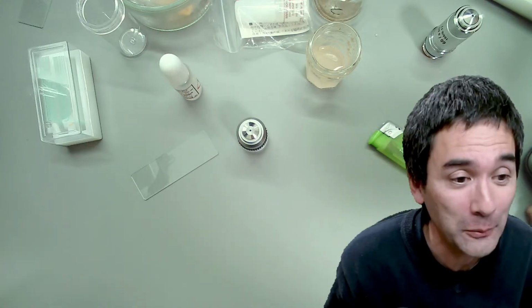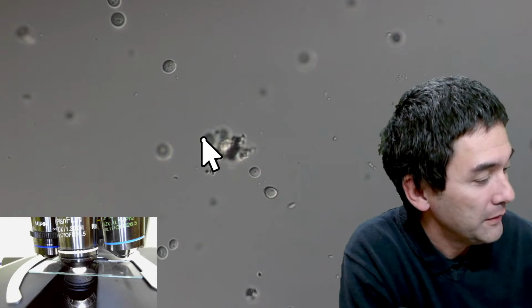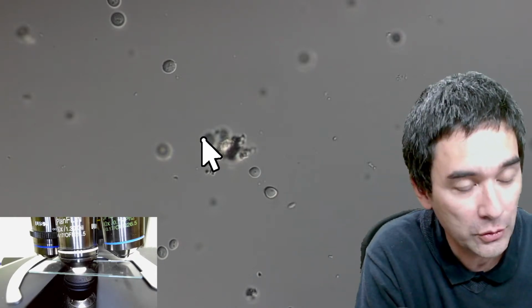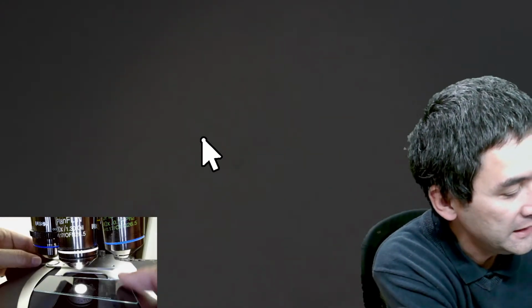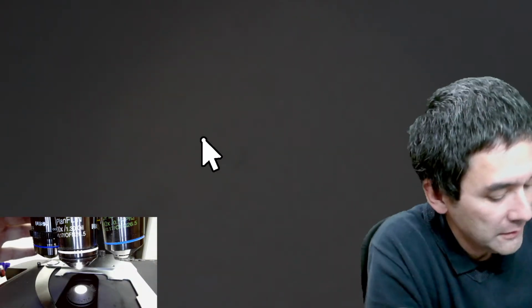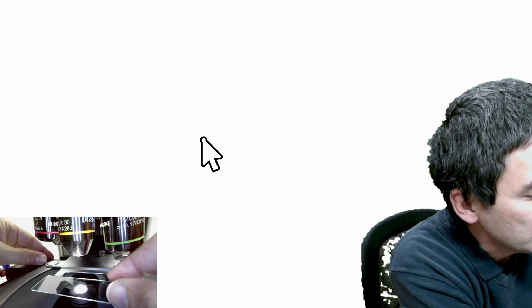So I'm going to do the following now. I'm going to lower this, and let's have a look at the slide. I'm just going to use this 60 times, as a maximum. Let's have a look at the dried yeast cells. Okay, see, I cannot go higher anymore, again because of the focus lock.